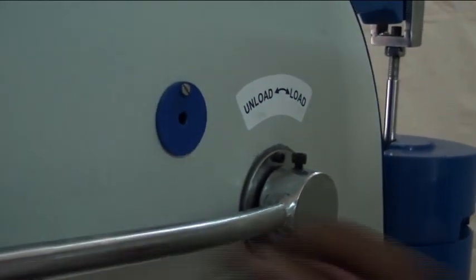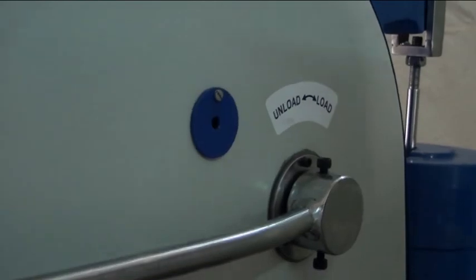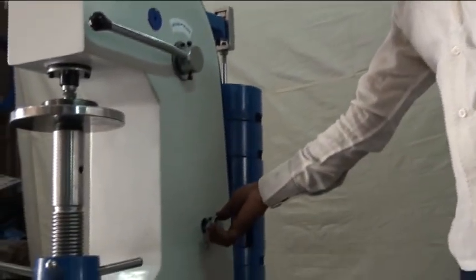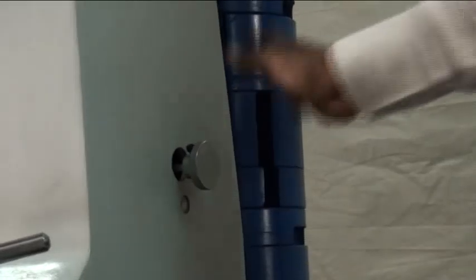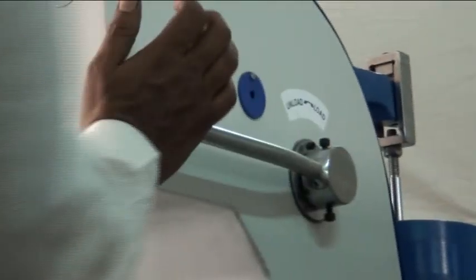As it is the speed of the handle, rotate clockwise or anticlockwise, which we have now. And take a reading to push the back side.